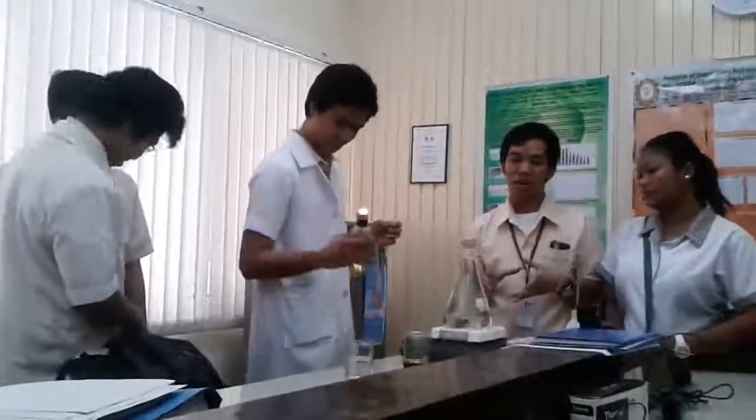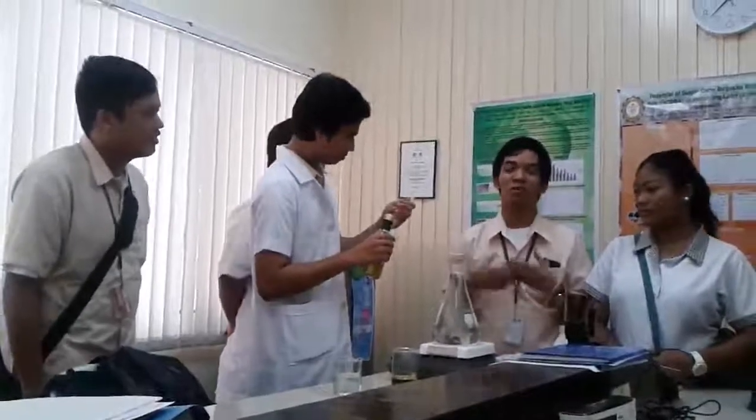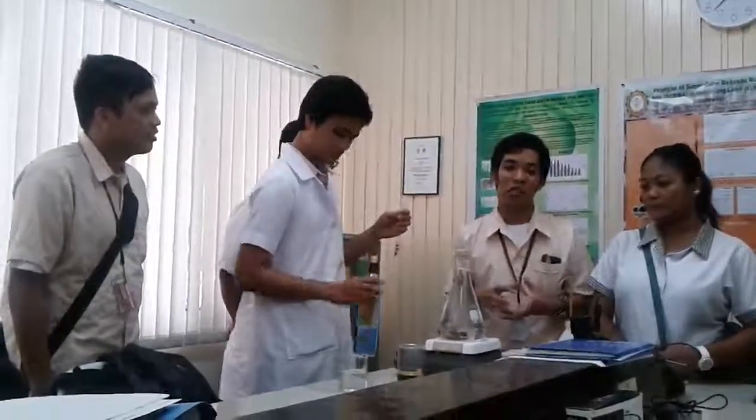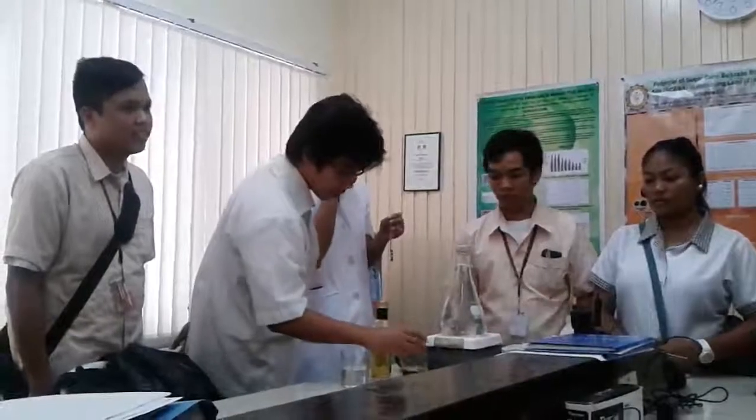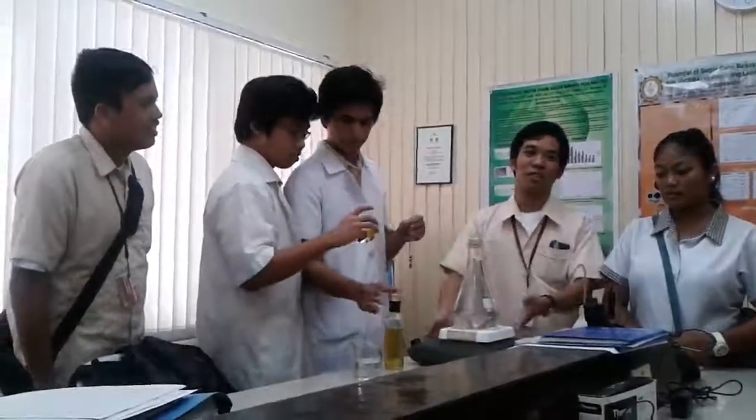So in the experiment, we are going to measure the viscosity. We're going to determine the dependency of viscosity on temperature. But for demonstration purposes, we're just going to use ambient temperature. If you want higher temperatures, obviously we need a heater.